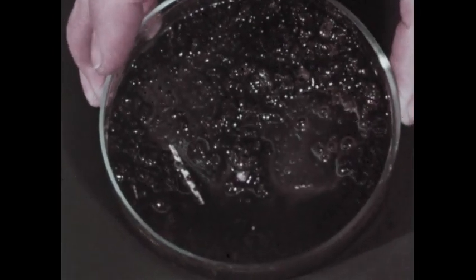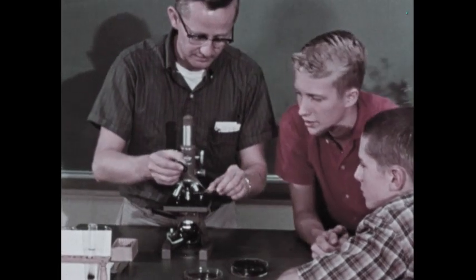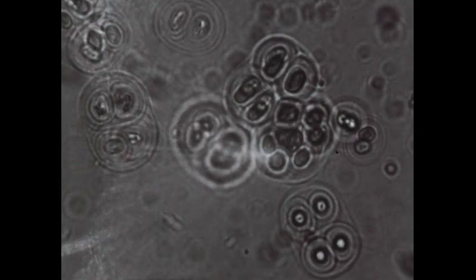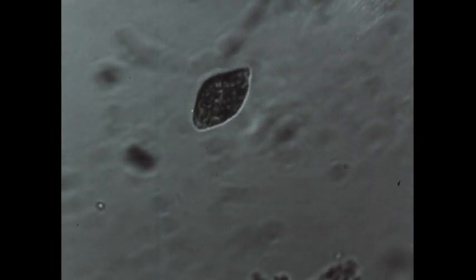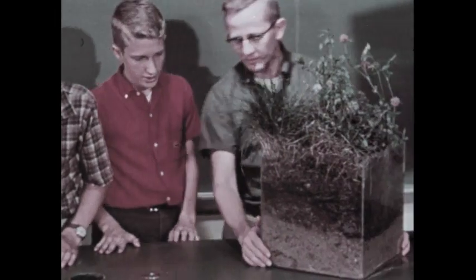Are the molds and bacteria we have seen the only forms of microscopic life found in soil? This sample of damp soil was taken from the edge of a pond and kept moist. Let's examine some of it. The wet soil sample is put on another slide. Here we see a species of blue-green algae. Like bacteria and molds, algae also contribute to the organic content of soil. In addition to algae, certain species of one-celled animals, the protozoa, also inhabit moist soil. This is euglena, one kind of protozoa found in moist soil. The protozoa we have seen are among some of the animals found in soil.